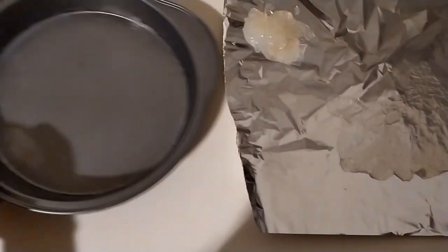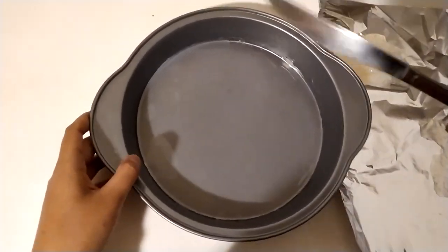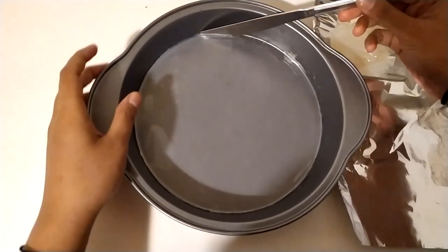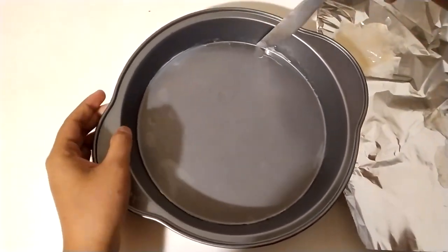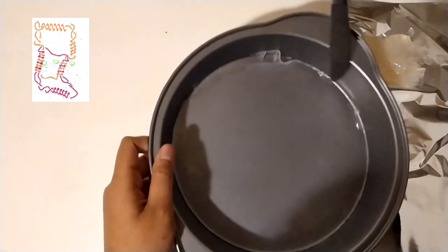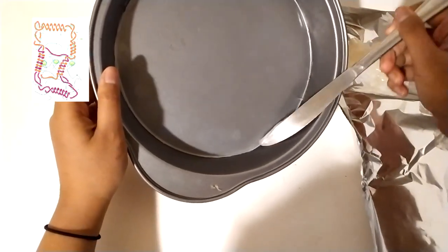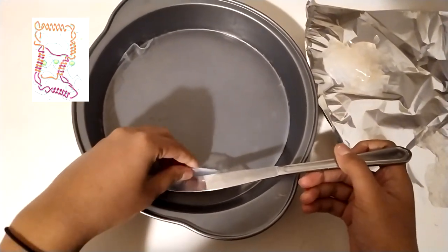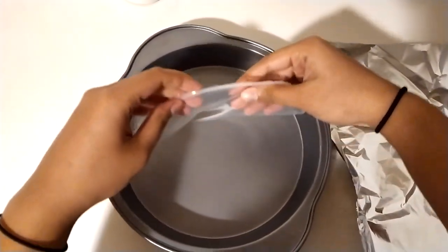Like I had mentioned before, after the gelation and cooling process, as you can see here, the agarose chains have formed side-by-side aggregates, which have condensed into a three-dimensional interlocking network held together by non-covalent hydrogen bonds — seen here as the bioplastic agarose sheet, which is 100% edible.